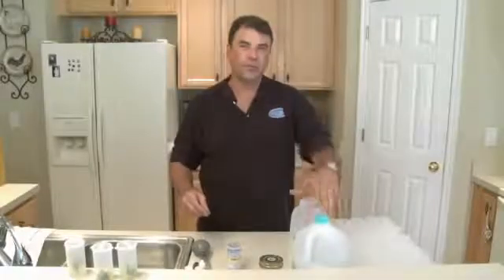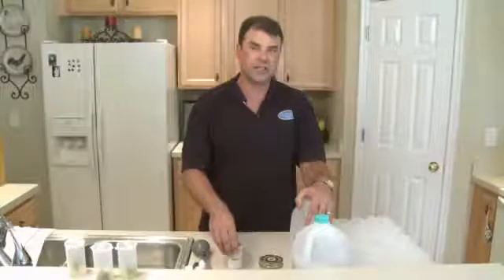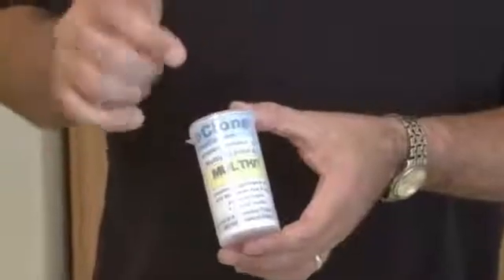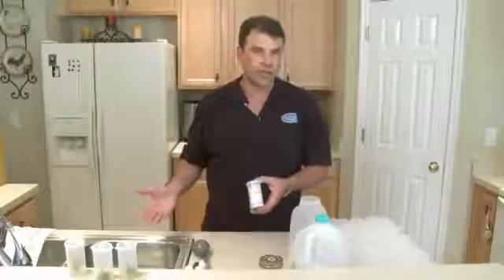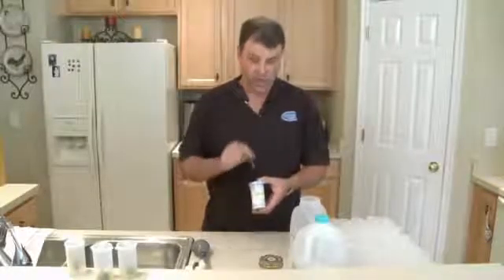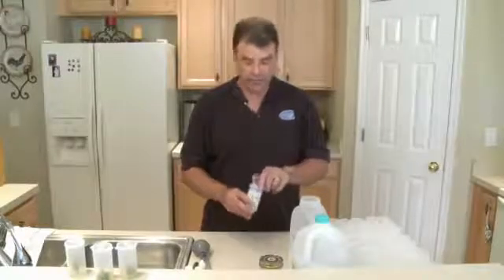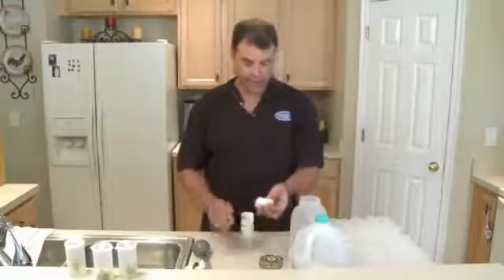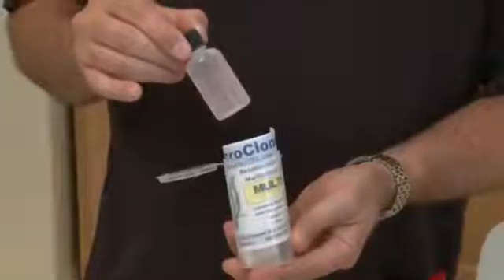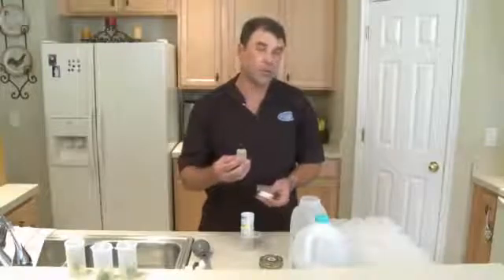What we're going to do — if you have the kits or if you purchased any of the materials from PlantTC.com — this will be your material kit for the multiplication version. The rooting version is exactly the same thing; we've only made the hormone different. I'm going to open this up so we can see what we've got inside the package. Inside our ingredient kit will be a bottle of liquid, which is going to be our hormone and preservative, all ready to go. This entire bottle makes one liter, and we're making a one liter batch today.